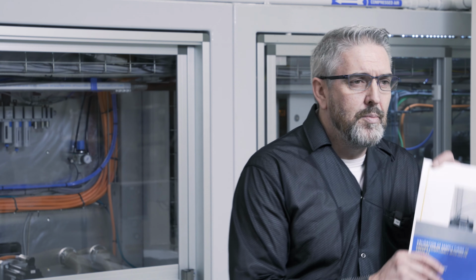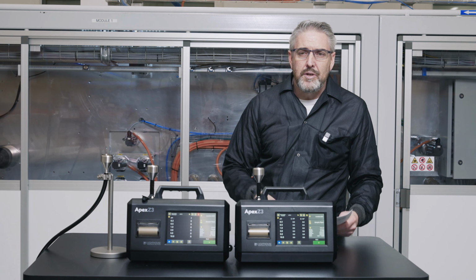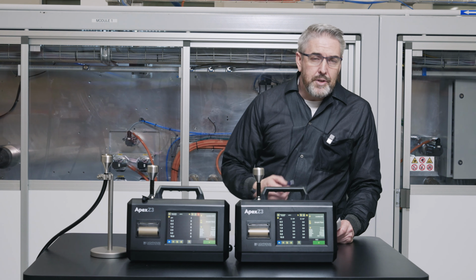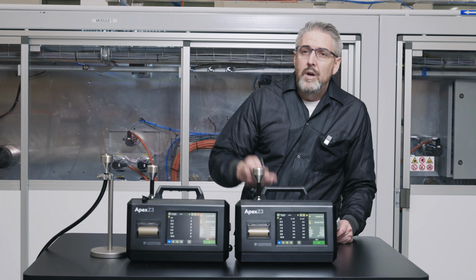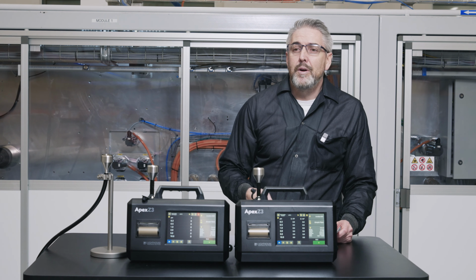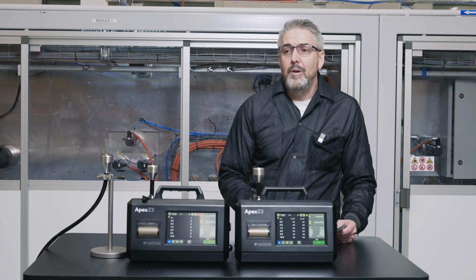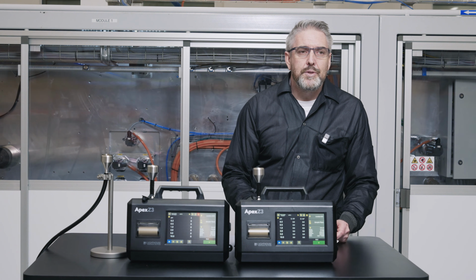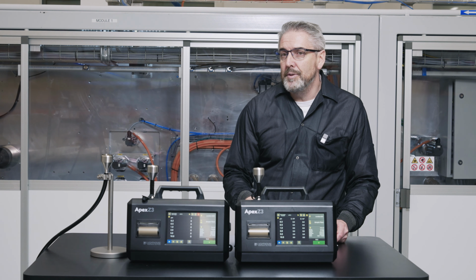So there's a decision tree in the SOP, in the actual standard itself, and that decision tree will determine when you need to validate the sampling system, because now there is an expectation for you to validate the particle losses in your sampling system. And today we're going to go through an SOP that we've developed, and this video tutorial will give you a good insight into how to validate the losses in your particle system.